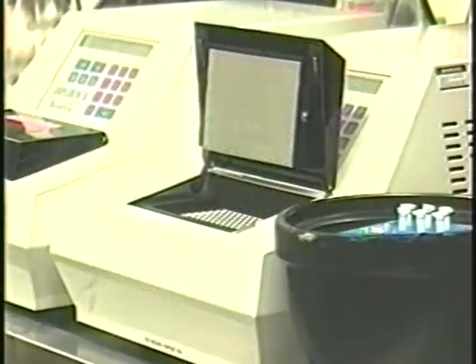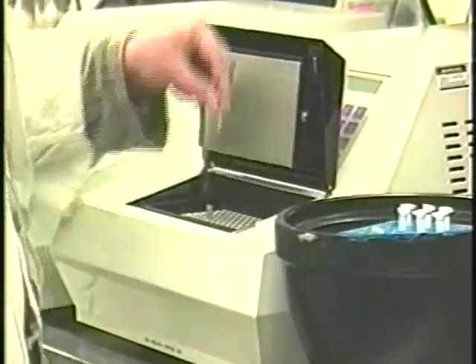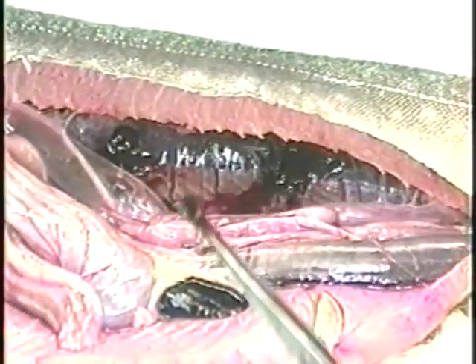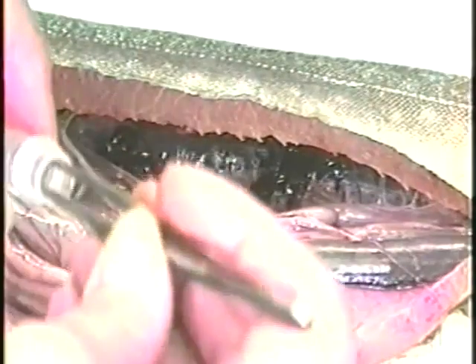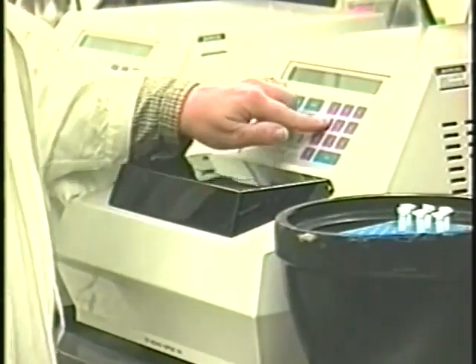If samples are to be analyzed using a technique such as the ELISA or PCR, you may be required to aseptically excise a portion of kidney and place it in a sample tube. Specific instructions for the technique and the amount of tissue to collect will be determined by the examining laboratory.